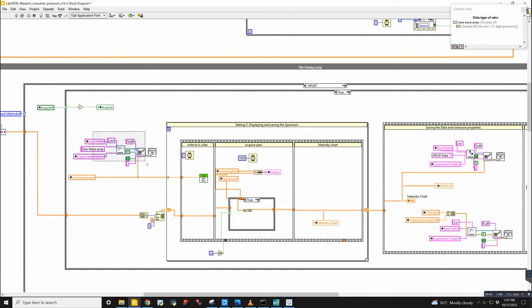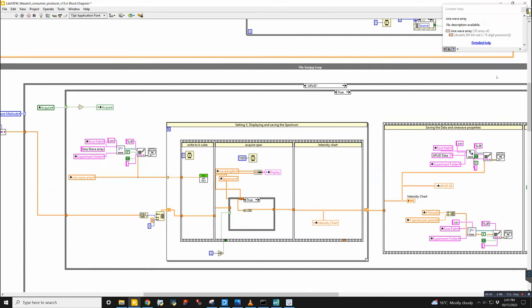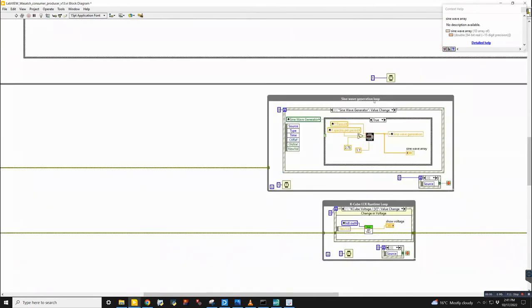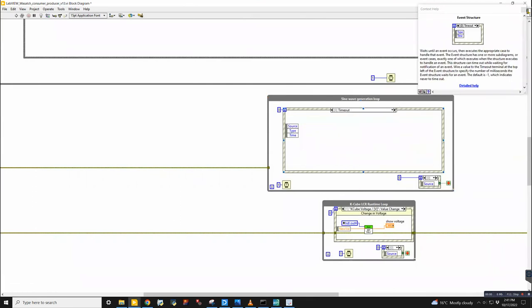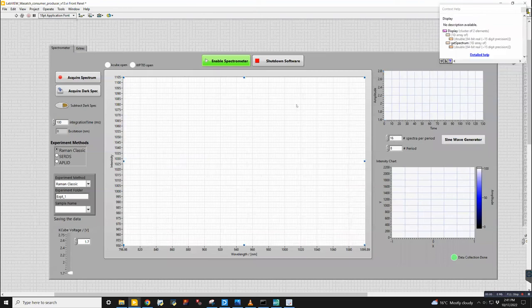So this is a naming thing, and this is the file of the sine curve that's saved with the data. That array here specifically, I think actually comes from this loop, right? So before I go into the applet, I'll talk about the sine wave generation loop. This is idling, doing nothing most of the time, waiting for you to change settings here. So if I run this, can you plug in the spectrometer, please, so I don't run into an error?